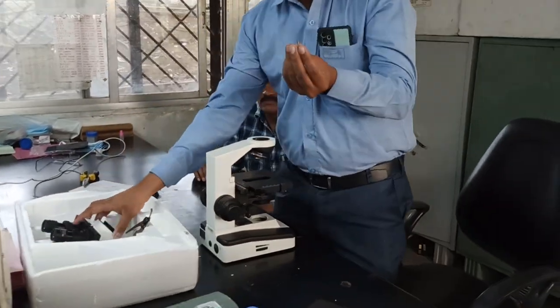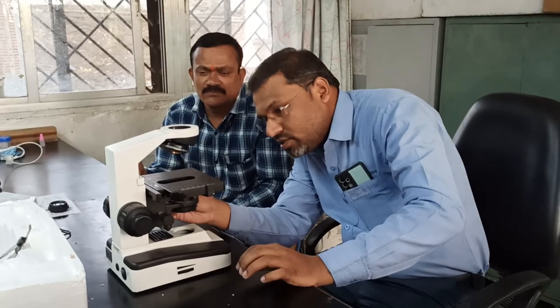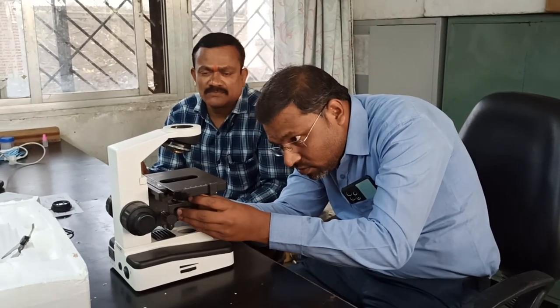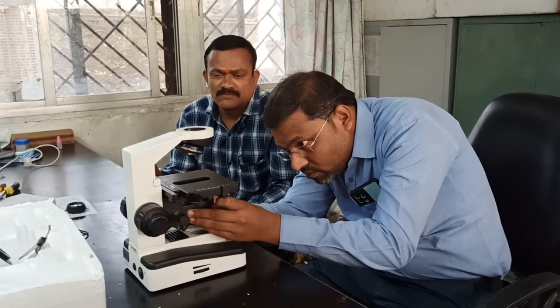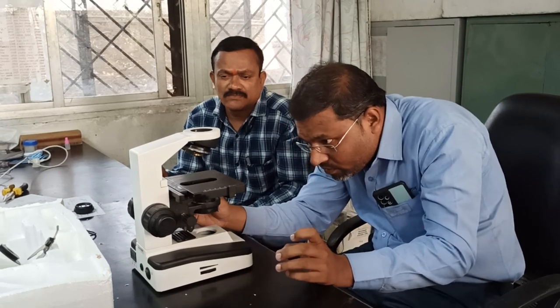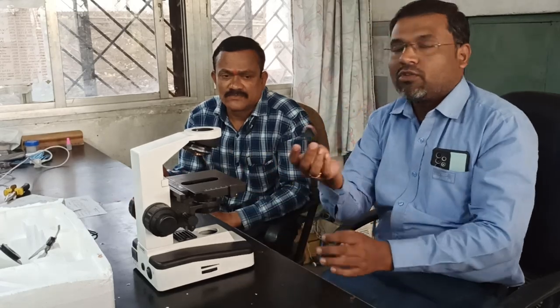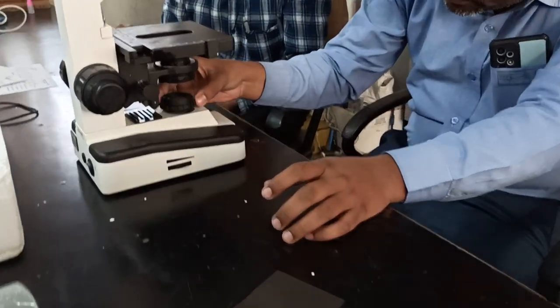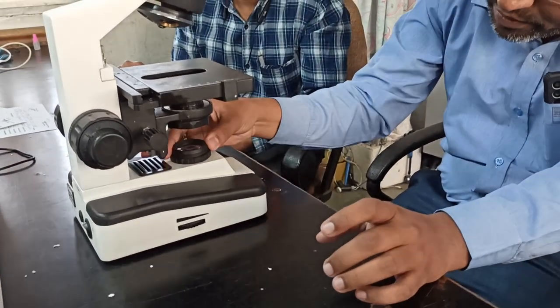This small Allen key you can observe. There is one slot provided at the right side. You just fix it in this slot. With the help of this, you have fixed this. Next one, this is nothing but a convex lens. You have to put it here. Just rotate it, and it simply gets fixed.